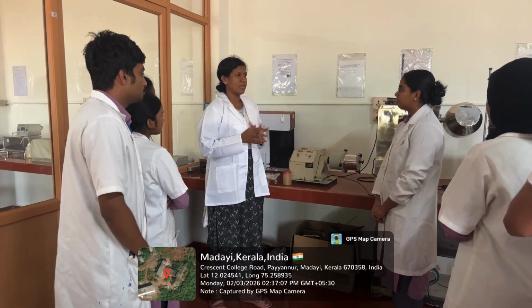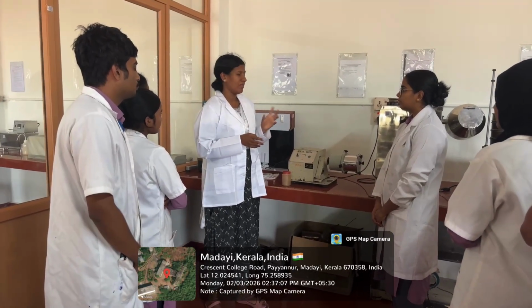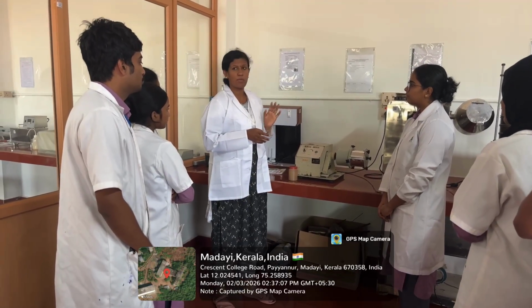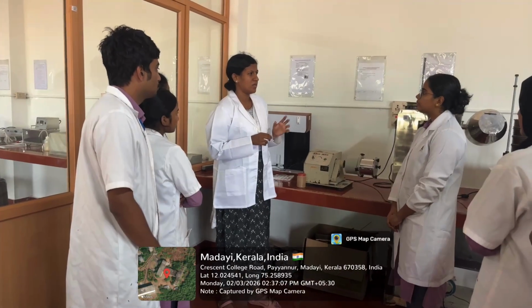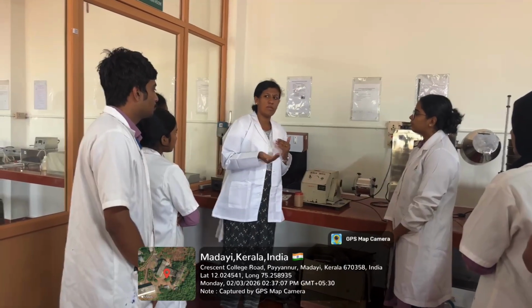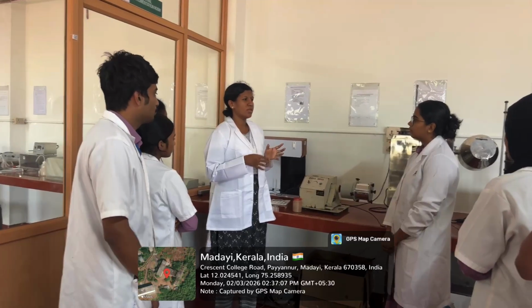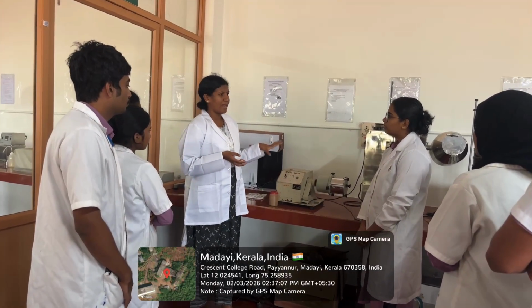We will be conducting a size reduction experiment using a ball mill, and we will analyze the size reduction ratio of the given sample powder. This comes under course outcome 1, in which we will identify the use of various equipments, and after completion you will be able to operate the equipment individually. Next, course outcome 2, we can analyze the data.